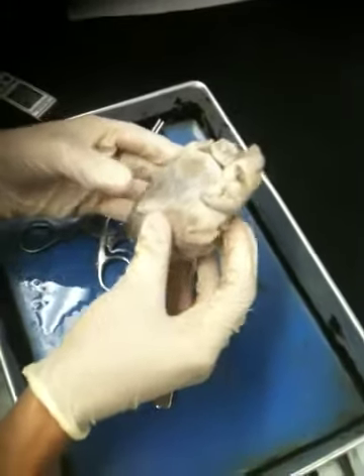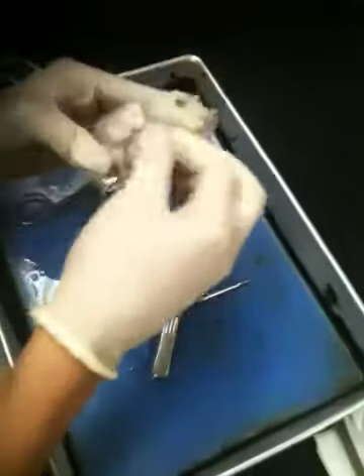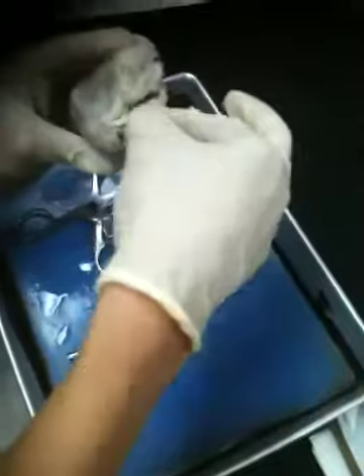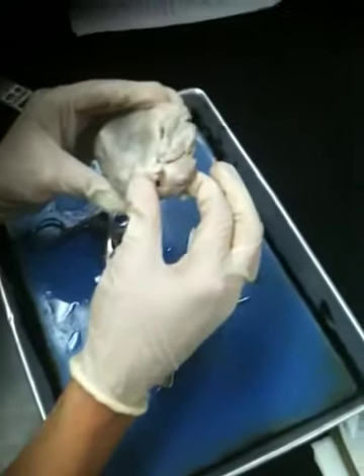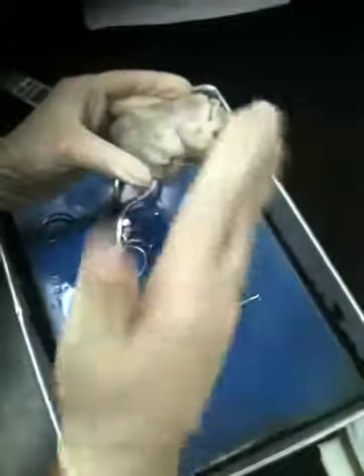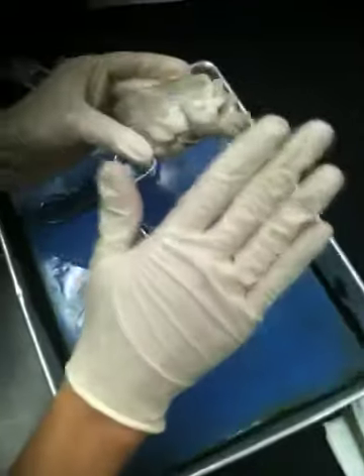pulmonary trunk? I'm not going to test you on those. You can see them here. For example, we can see the pulmonary trunk right here. There's even a little piece of the aorta over here, but they're not as clear as they are on the plastic models. So what we've been listing as we go is what I'm going to test you on for the sheep heart, and those vessels are not included.